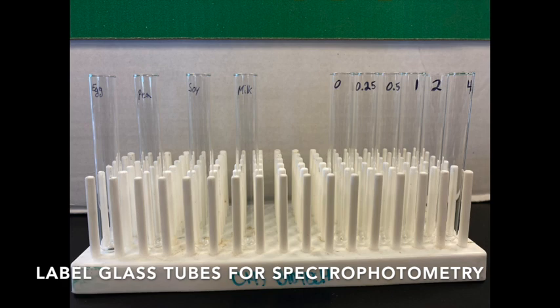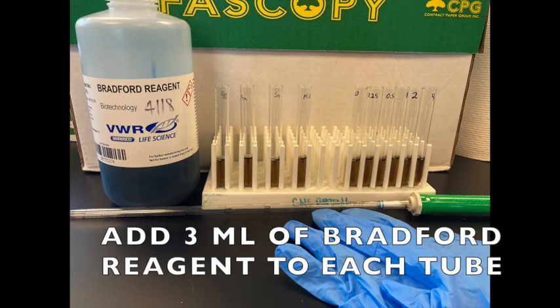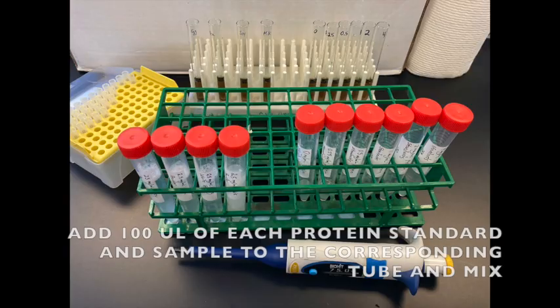You have to use glass tubes for spectrophotometry, so we'll label a set of glass tubes here. We will then add Bradford reagent to each of the labeled tubes to help us visualize the proteins using color in the spectrophotometer. We will then add a small amount of each protein standard and sample to the corresponding tube and mix it well.